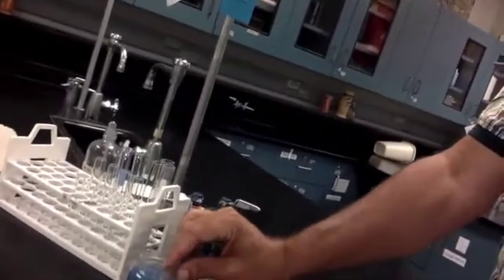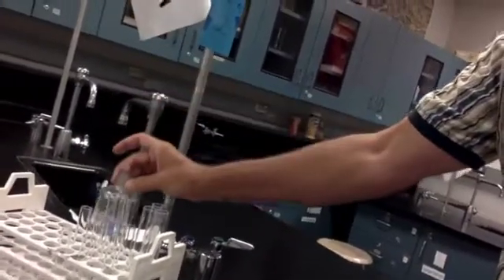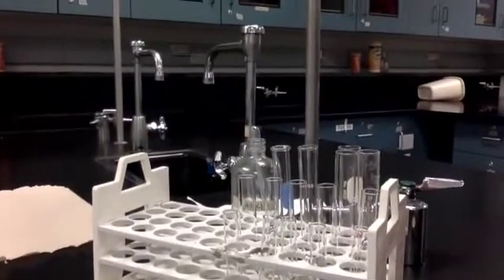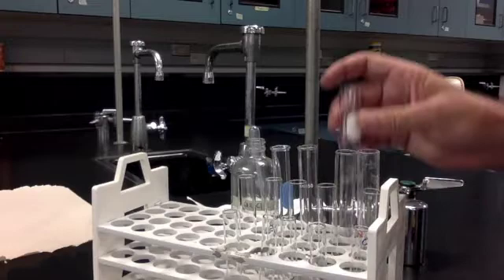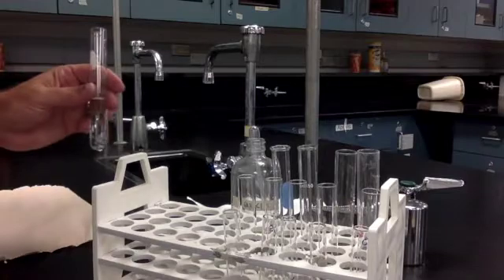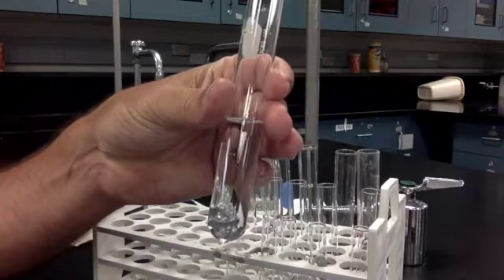Okay, moving down the line, station 2, the next peninsula down, is putting zinc and acid together in a test tube and observing the change that occurs. At the end, you will be asked to decant, D-E-C-A-N-T, the acid off of the zinc. Now, decant simply means I have zinc on the bottom, I've got liquid on the top.